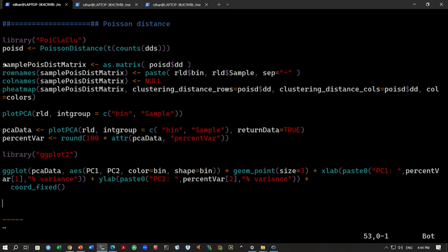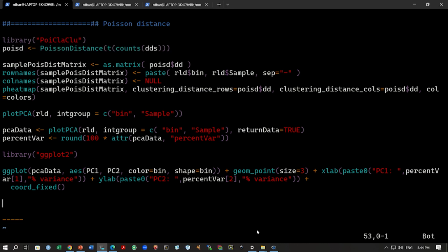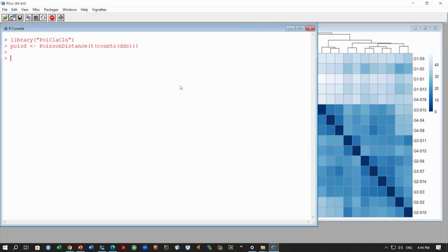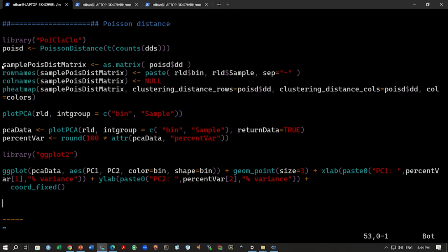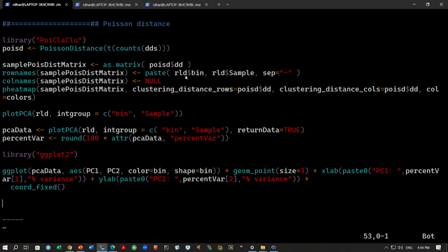I will go through this very quickly, just to compare the results with our earlier results. We will see we get very similar results, whether you go through the R-log transformation and the Euclidean distance, or whether you go through the raw count data and use Poisson distance. We get the same results. I will simply copy this code because this part is the same as before. Instead of this rld, we are just using this Poisson distance, although we are taking the names from the rld$bin, but that is okay. We are just labeling the row names with this bin and sample, but the distance data comes from the Poisson distance.